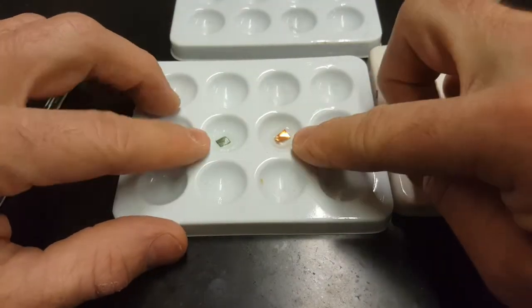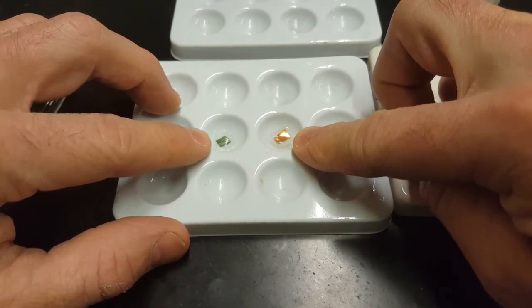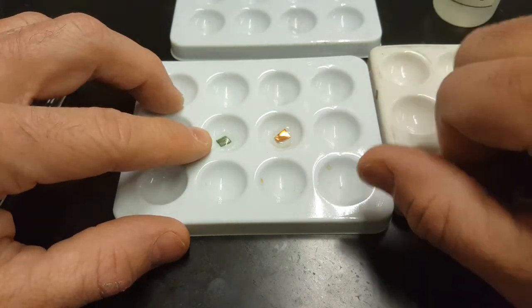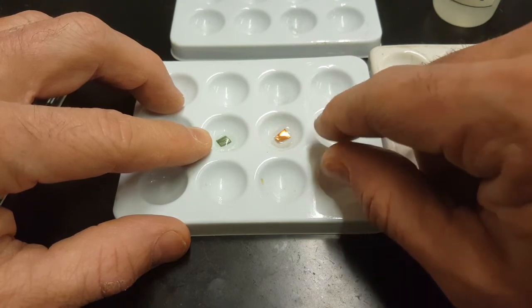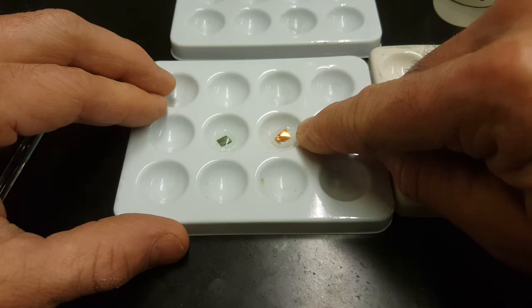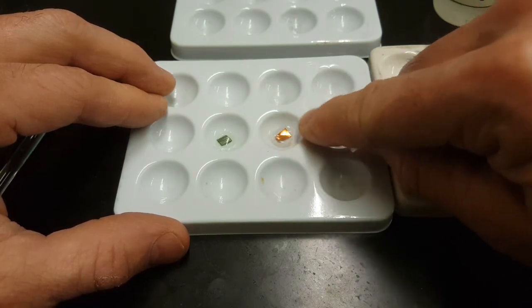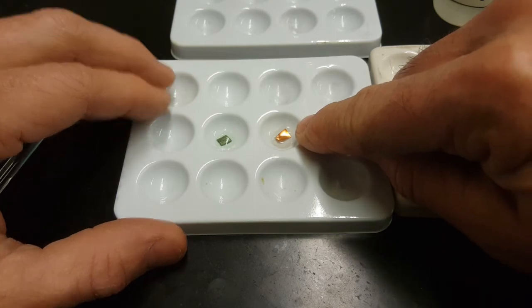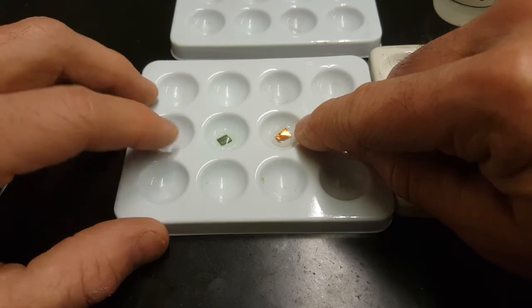You only need to do one of these 2 reactions to get the information that magnesium is more reactive than copper and sits higher on the metal activity series. Here, this data would tell us that copper is less reactive than magnesium and sits lower, because there's no reaction with solid copper and magnesium ions. Absolutely nothing is happening here.